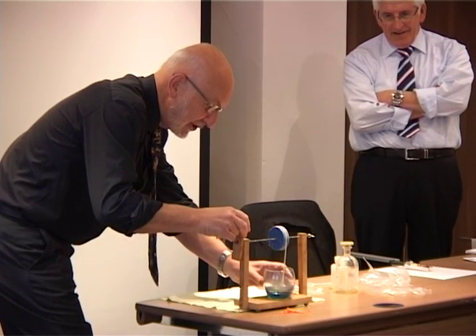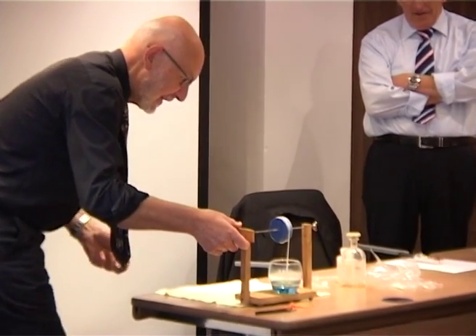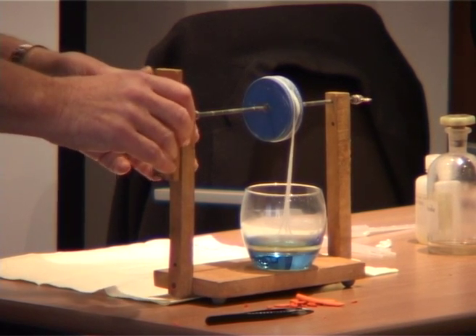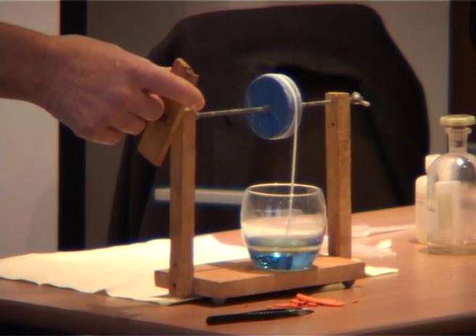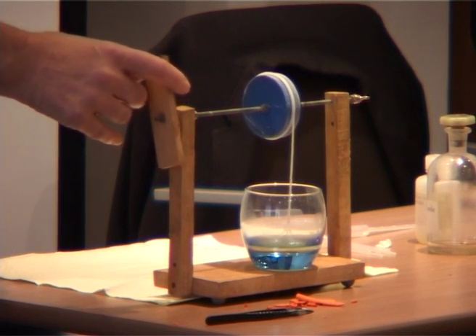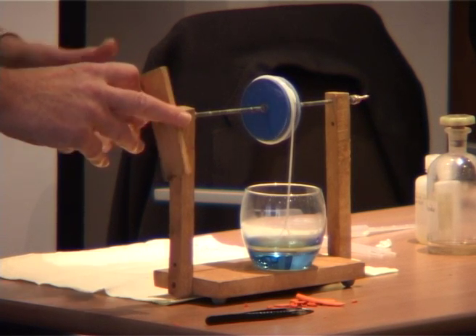And it's formed at the interface. It can only form at the interface because that's the only place where the two liquids come into contact. The two reagents come into contact. Most of the reagent is either in the water or the other half of it is in the hexane, and therefore not in contact with its counterpart. The only contact occurs at the interface. As we pull this polymer out, the interface gets renewed, of course, and more polymer gets formed. And on we go.